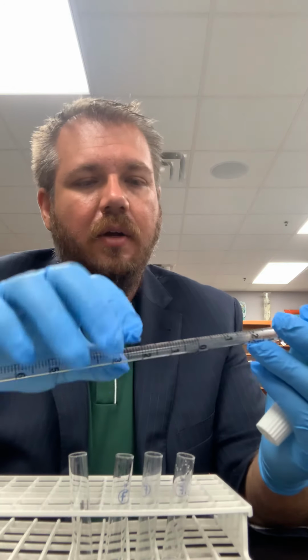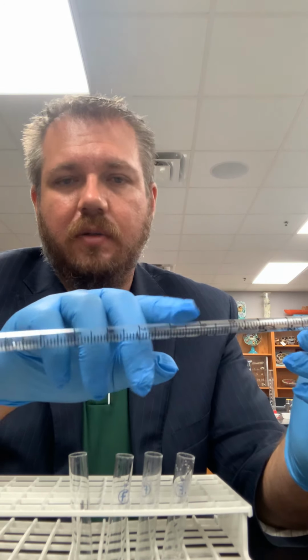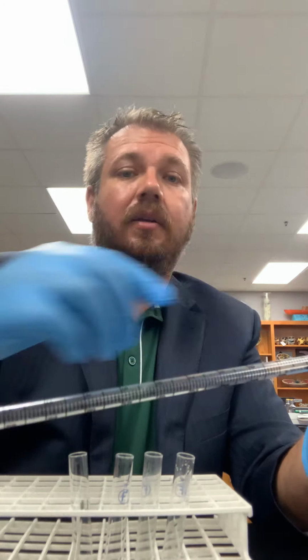Alternatively, you can do what I like to do, and that's to use the ones that go up, so that are increasing volume as you go this way. To me, it's just more straightforward. I only like to draw up what I'm going to dispense. So if, say, I wanted to draw up 8 milliliters of water, I would draw up 1 milliliter, 2 milliliters, 3, 4, 5, 6, all the way up to 8. And then I have only 8 milliliters in my graduated pipette, and then I can dispense that into my test tube. So just pay attention that you do have two sides. Again, I recommend using the side that counts up from 0 to 10.